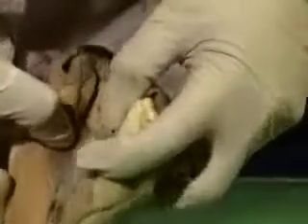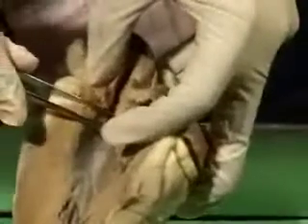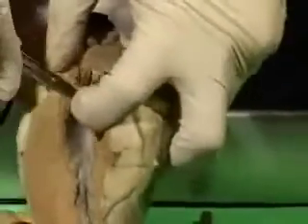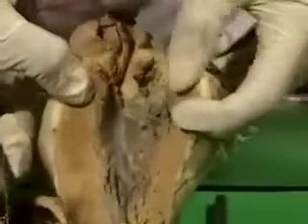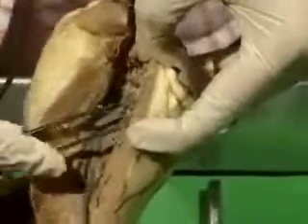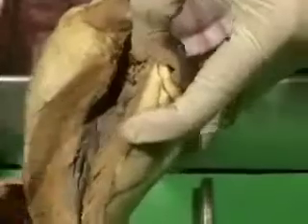And then we have the aortic opening, which is this one. And see, in the aortic opening too, look at the semilunar cusps. So see this? This is the semilunar cusp seen in the aortic opening up here. Okay. There. So that's the semilunar cusp up here in the aortic opening, and this is the cusp which has the chordae tendineae attached to it of the atrioventricular opening.